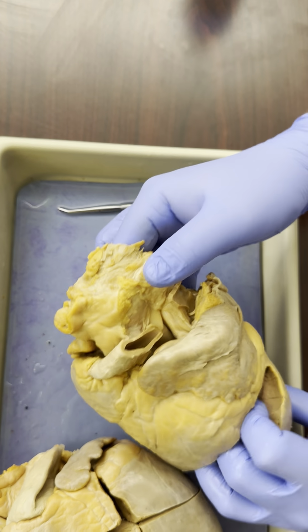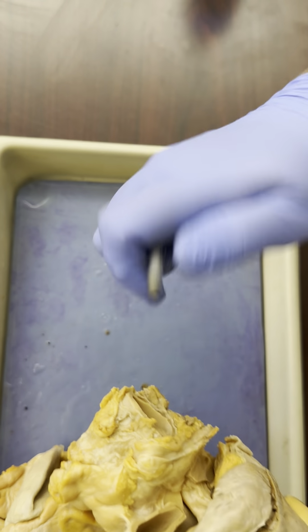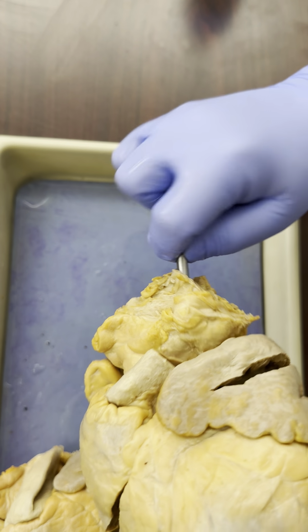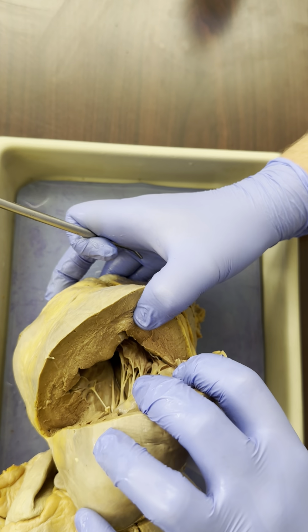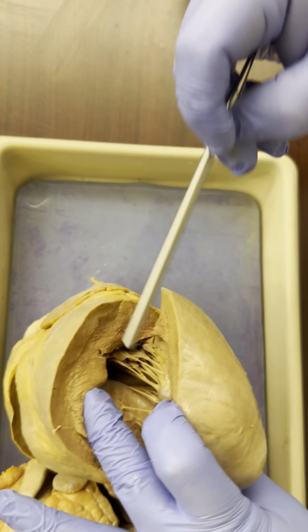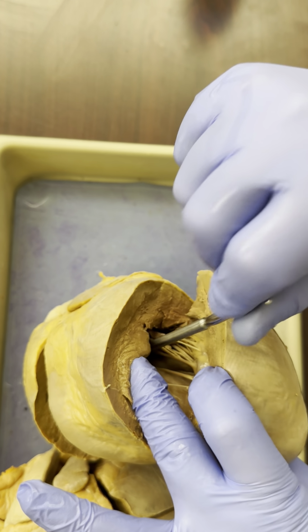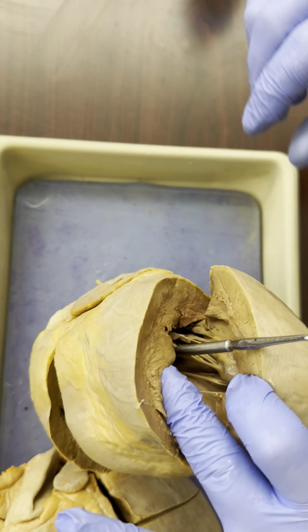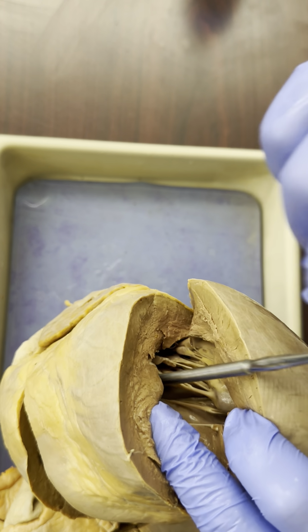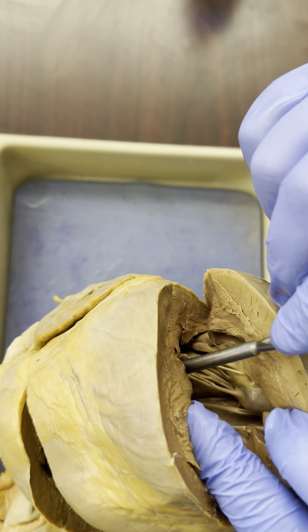It's a little hard to get my finger or even the probe through, but I'll give it a try just to see. I don't think it's going to happen. But if we were to look inside the left ventricle, going upward towards the aorta, in this cavity here, we would see another valve. We would not use this heart to show you that valve. We'll see it on another heart. But up inside here is where we would find the aortic semilunar valve.